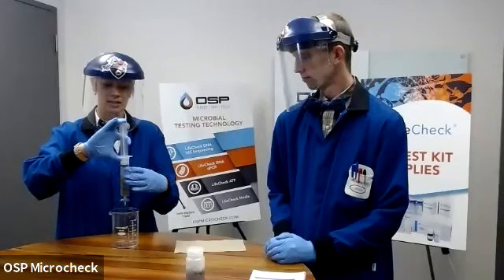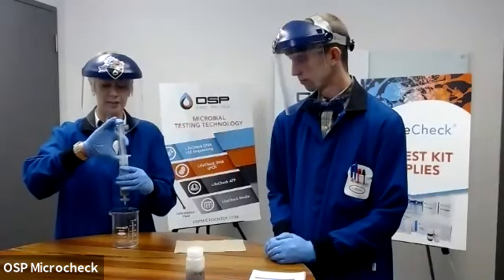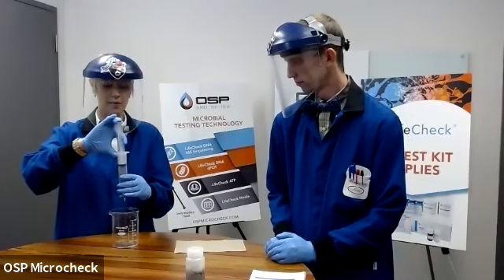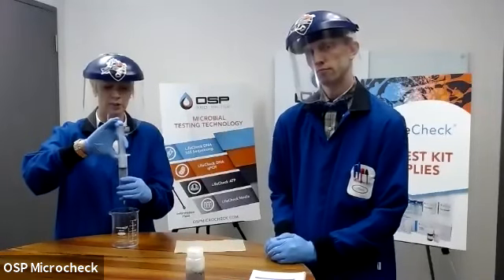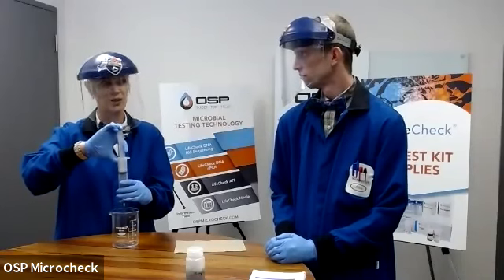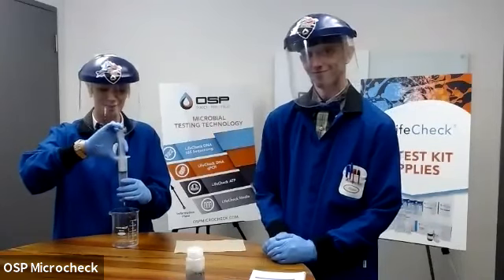You can see the fluid spreading out across the top of the filter. That's nice. You don't want to push too fast or too hard. If you are using your own disposables, make sure you have a Luer lock on the end of your syringe to make sure that filter's on there tight, because we have had experiences where it'll pop off and make a mess.